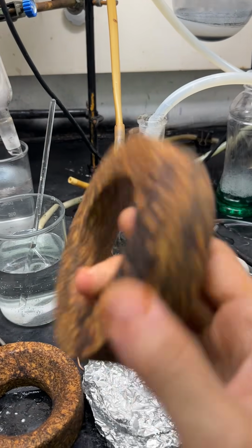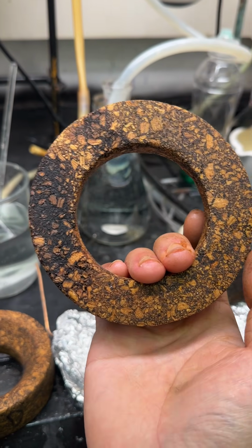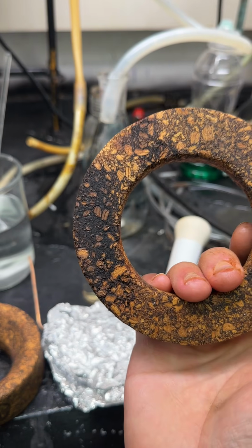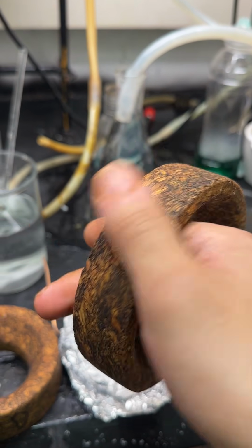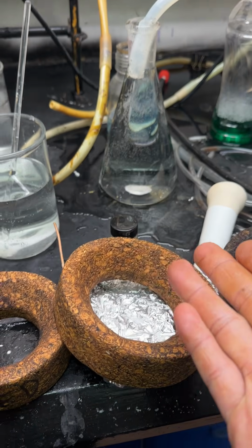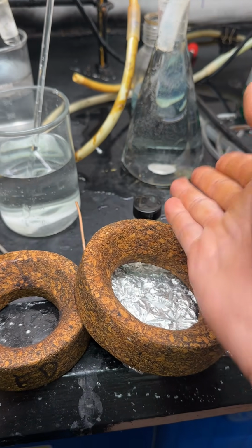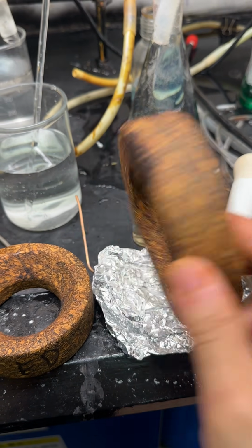But anyway, because of that, these often get water damage, and what happens when you soak cork with water? It molds, a lot of mold. But anyways, these look a lot better because I sanded them earlier. I thought, that's stupid, why are they bare cork? It wicks up solvent, it wicks up water, it wicks up sulfuric acid. It's just not very chemically resistant.